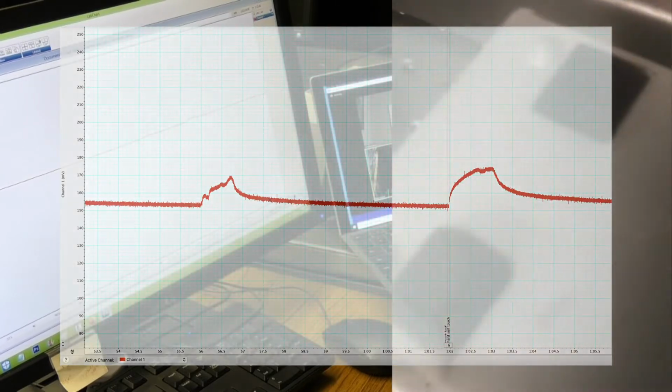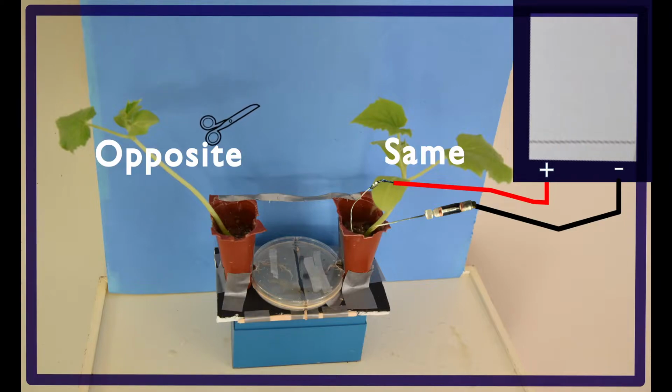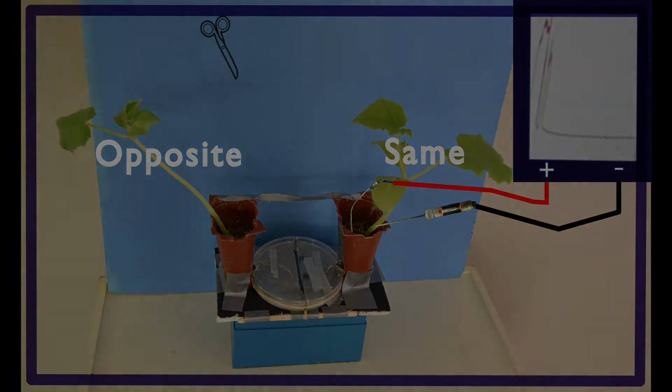This is another test that helps ensure our setup is recording properly. Third, we snip a leaf on the same plant we are measuring in. If all the equipment is functioning properly, we will undoubtedly see a large spike in the voltage potential, upwards of 20 to 50 millivolts, after magnification and gain are considered.